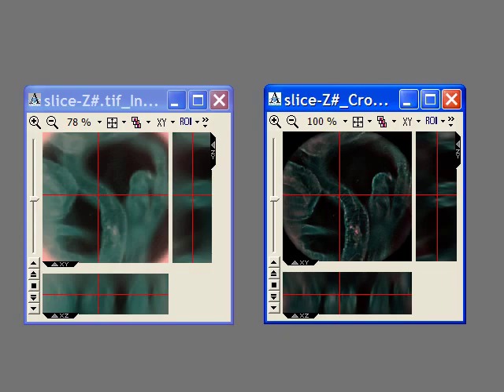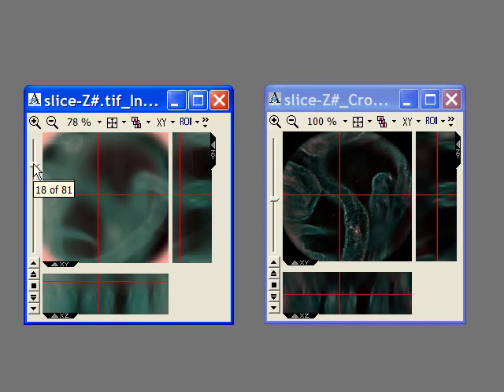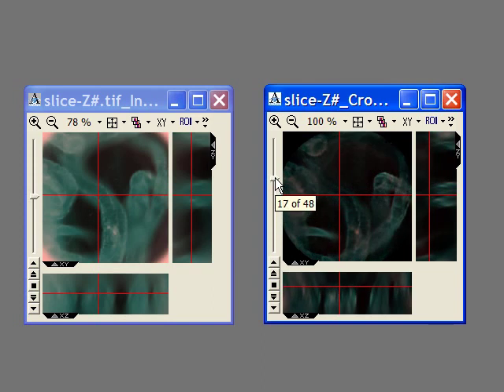Finally, some three-dimensional reconstructions. On the left, the focal stack of our insect legs, color inverted. On each plane, you can see blurred contributions by features on all planes. However, after three-dimensional deconvolution, as described in the paper, we have a volume of cross-sections. In this volume, objects not actually present on a plane are no longer visible.